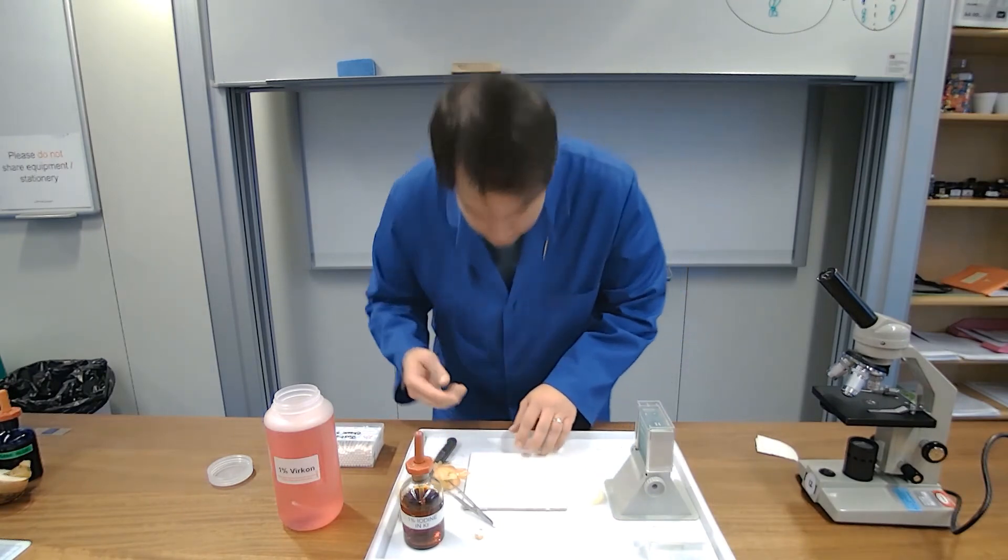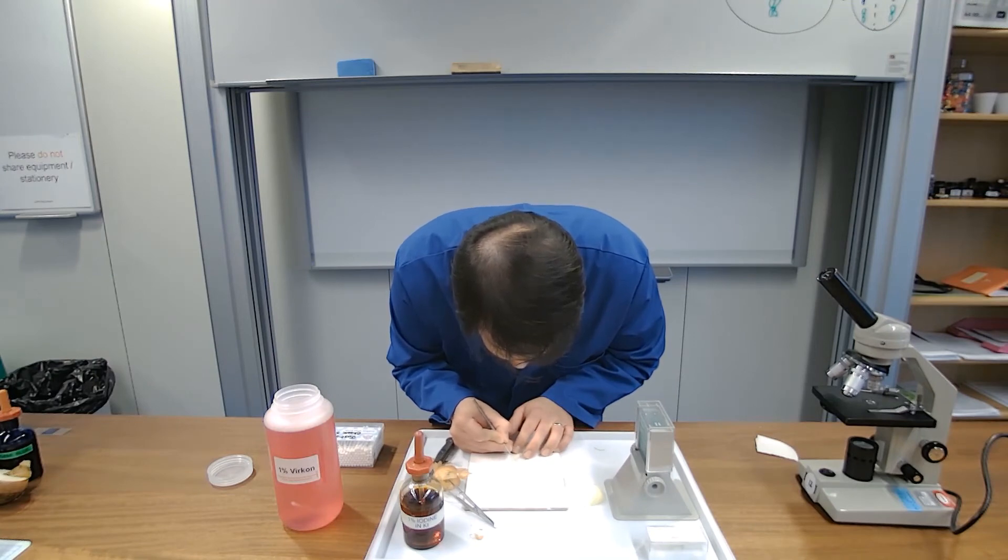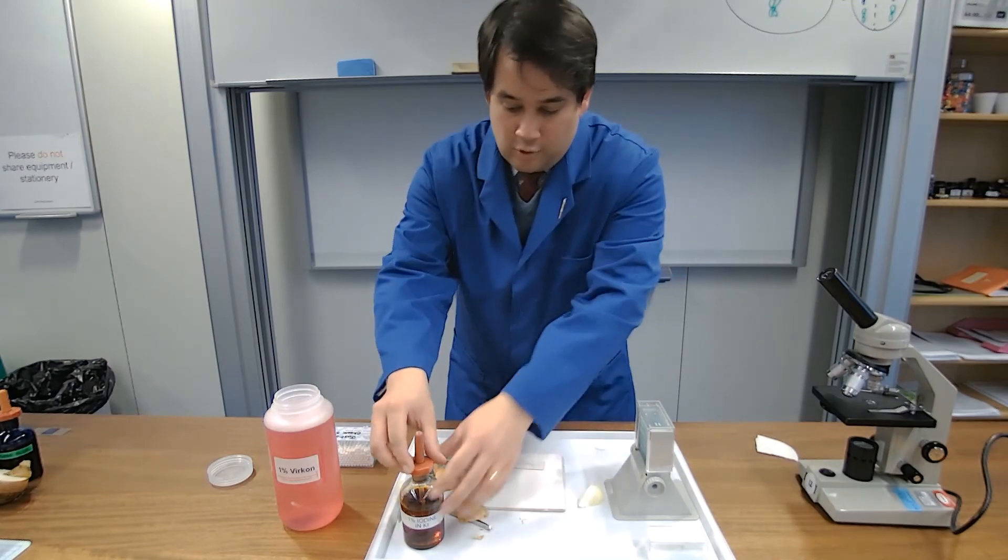We're going to put that onto our slide. Stretch it out. Ensure that we have just a single layer of cells.